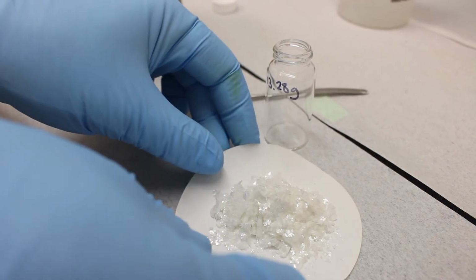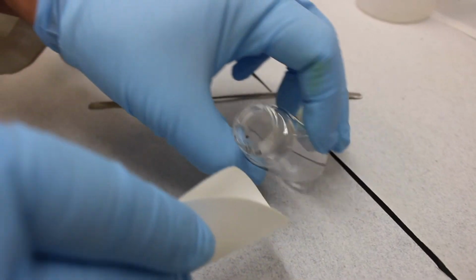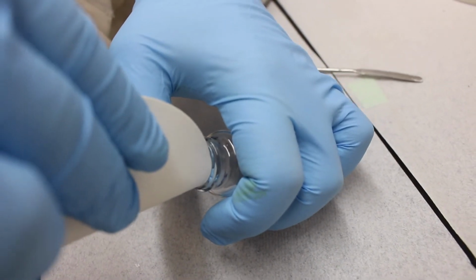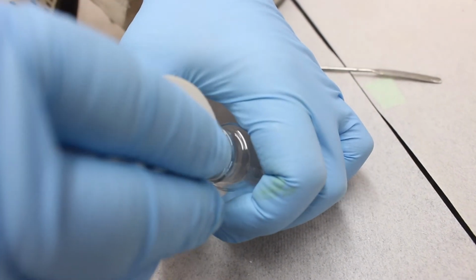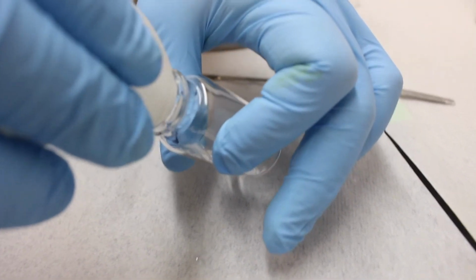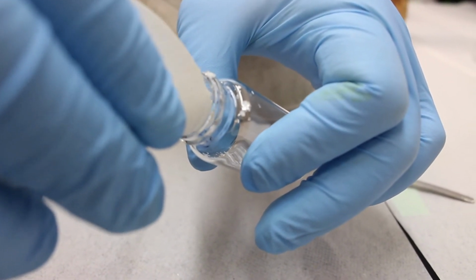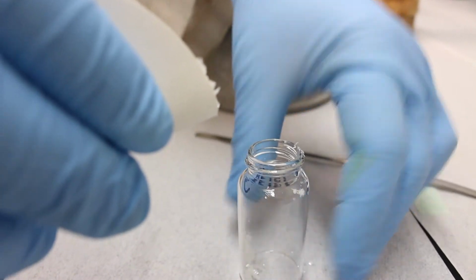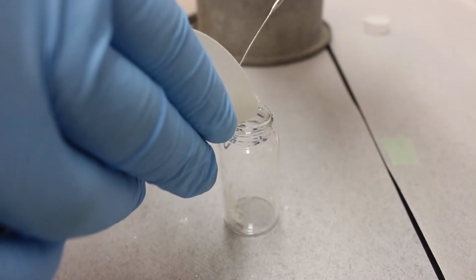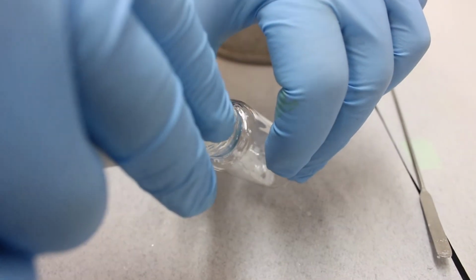Okay, so with any luck, and it's very difficult to do this without spilling it, let alone on camera. So you fold it into a little taco here and try to nudge it into there. Yep, you can see it's getting in there. Oh, I spilled, so that's alright. It's not too much. In fact, I might just lay that down and use a spatula to break up the crystals, because they're so large and very difficult to get into the vial. So let's try that now.